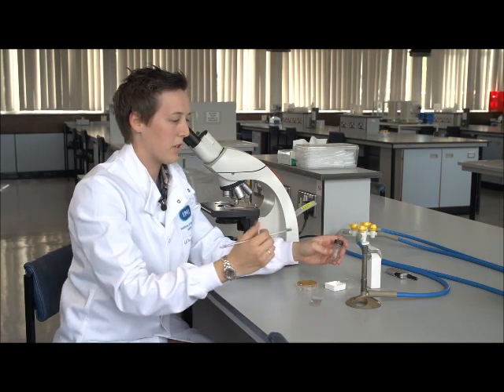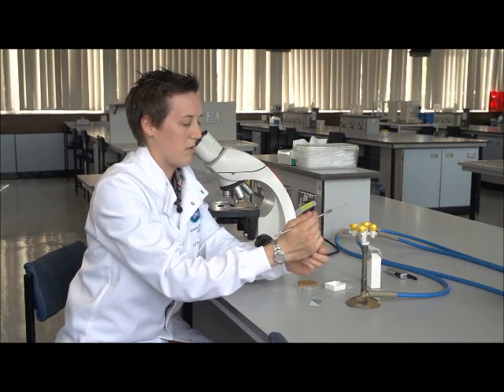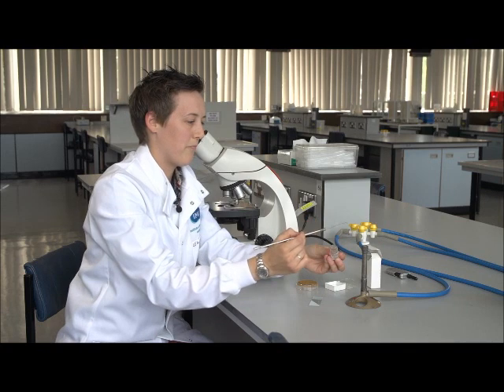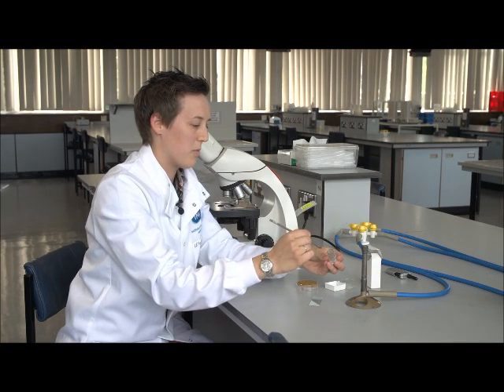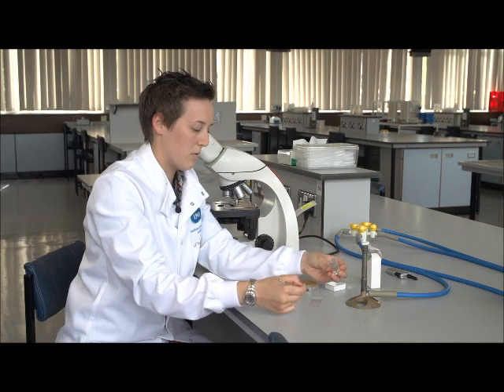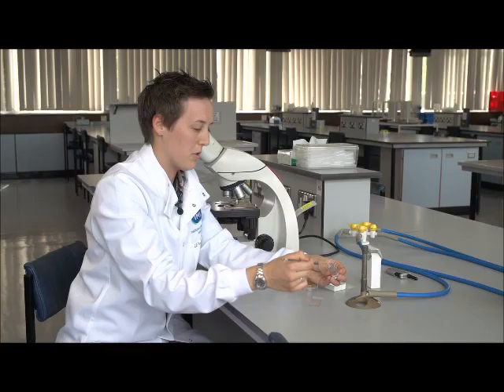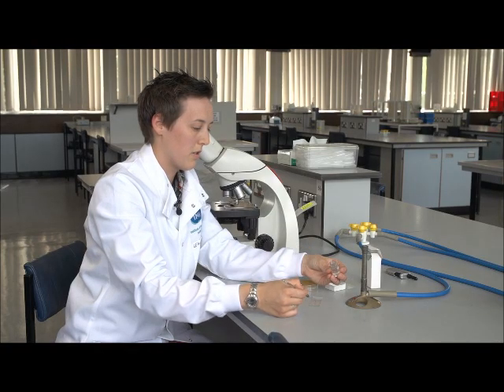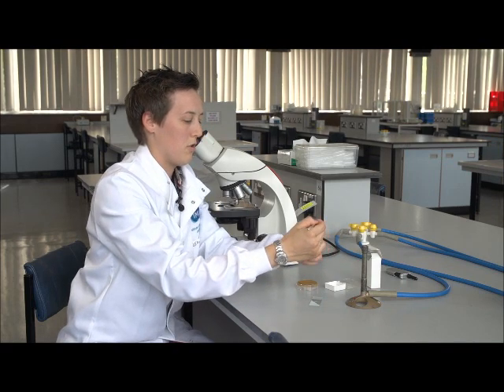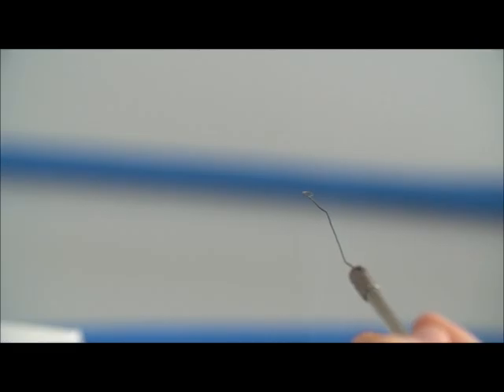So first of all, I'm going to open my bijou with my little finger, flame the neck, flame my loop, touch the side of the bottle, go into the water, take a loop full of water, tap that on, and do this just a couple of times to get some water onto the slide. I can then flame the neck, do my bottle back up, and flame my loop.